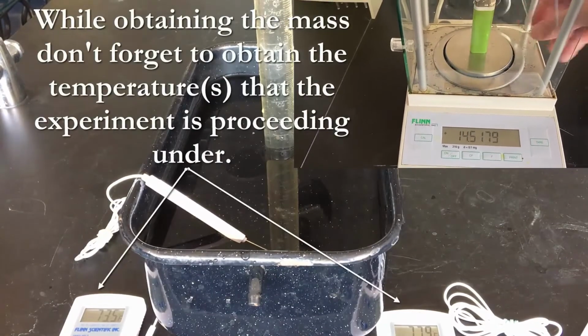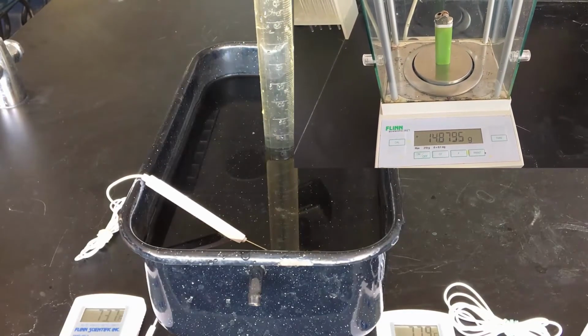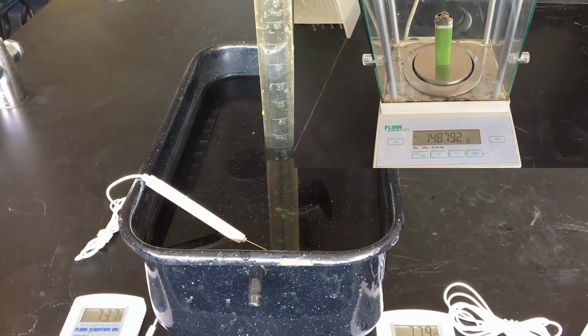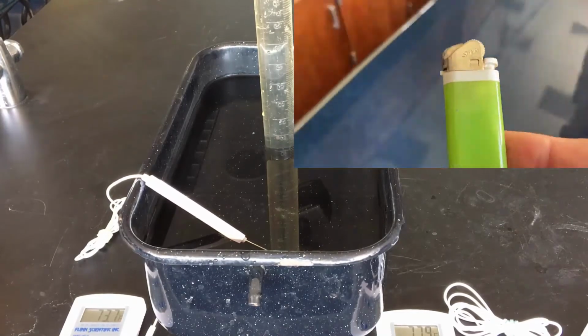So I'm going to go ahead and measure that. Realize that I've got two thermometers going on right now. One is measuring the water temperature in Fahrenheit. The other is measuring the room temperature in Fahrenheit. It would be best if we used everything in Celsius, but right now I've got it set at Fahrenheit.